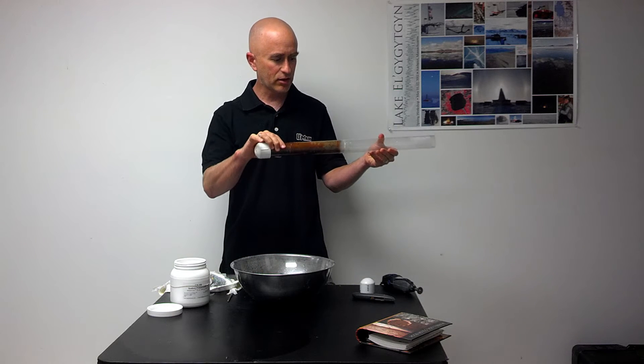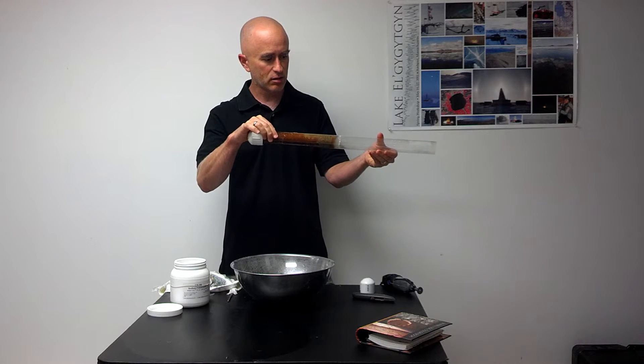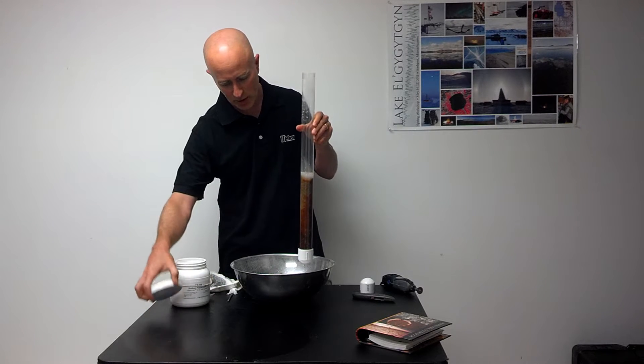It preserves the sediment. Now even if I turn it over sideways, the sediment stays in position because the gel has formed on top with that last remaining water.